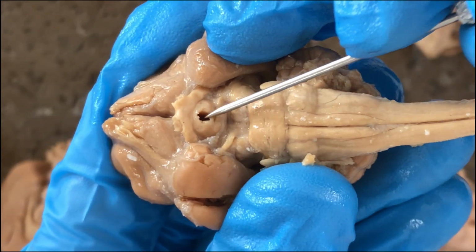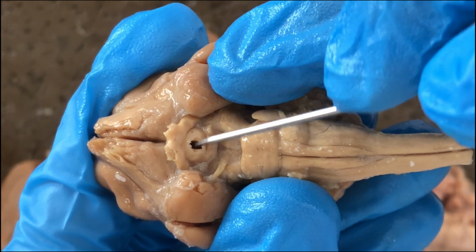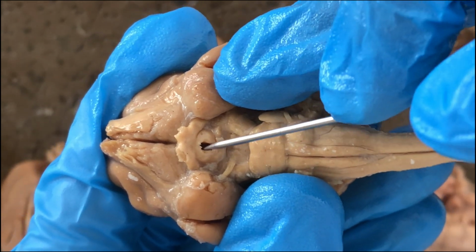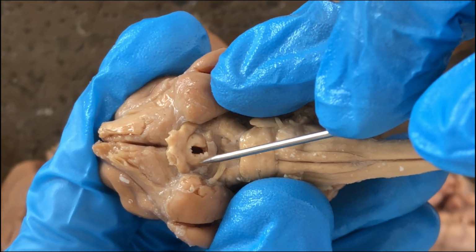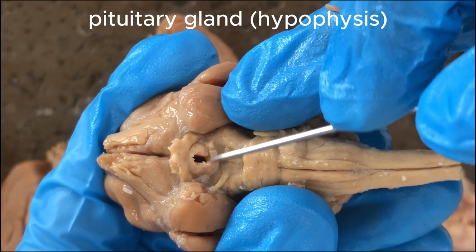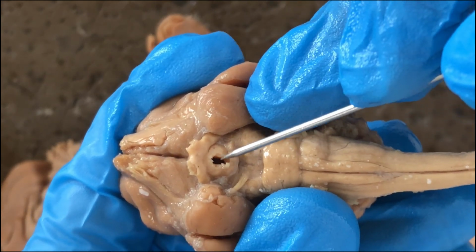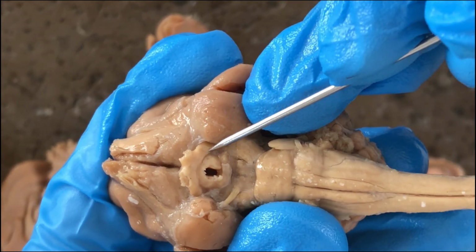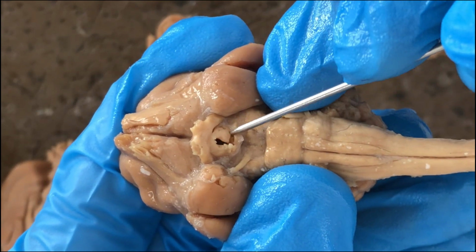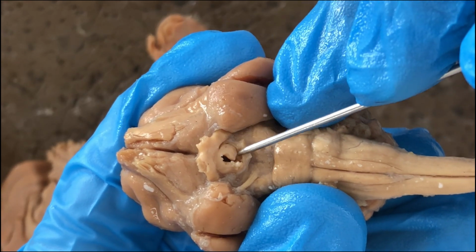And here you see a hole. In life, there should be a little sac-like structure there. That was the position of the pituitary gland, specifically the posterior lobe of the pituitary gland, which was suspended via an infundibular stalk. And this rounded eminence or rounded portion here at the base of the pituitary gland would be the tuber cinereum.